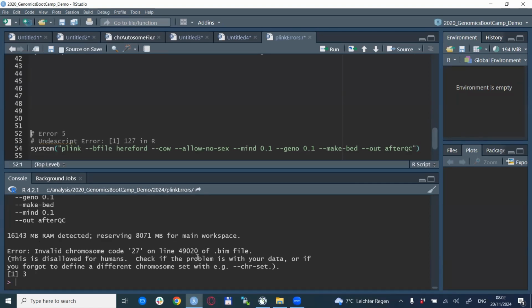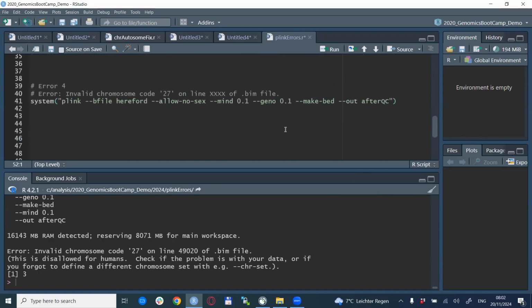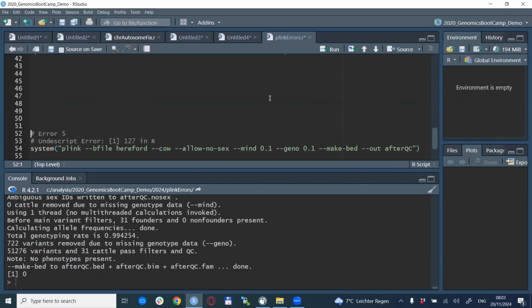Well, this line could differ, of course, depending on your data, but it will complain about the invalid chromosome code. And that is actually also somewhat described here. So this is also one of the examples with somewhat helpful tips. It says that we need to consider the correct number of chromosomes in our data set. So the dash dash chromosome set and the number of chromosomes in an overall solution, but for some species, you can also include specific keywords. For example, for cattle, this is dash dash cow. And when we run this one, then we get the correct answer without errors.